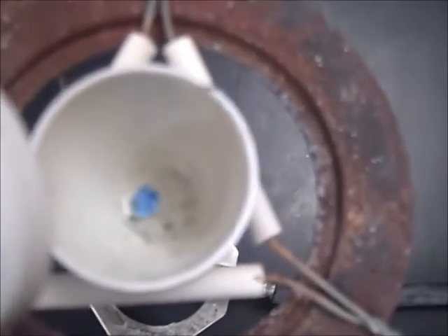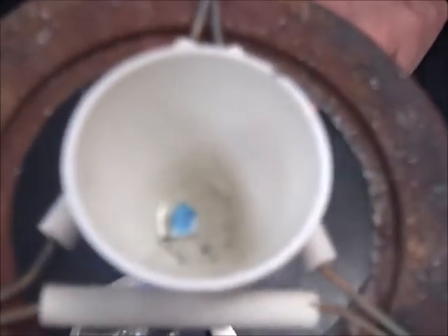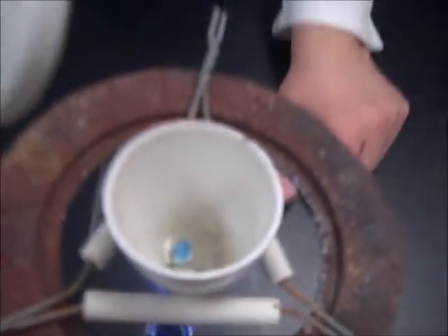Yes, and that's what happens. What's going on is all the water is actually coming out and breaking apart. It's decomposing. So we got some evaporation of the H2O going on? Yeah, you really can't see the vapors as well here, but you can see it's definitely getting lighter. See that? Great. And that's about it.